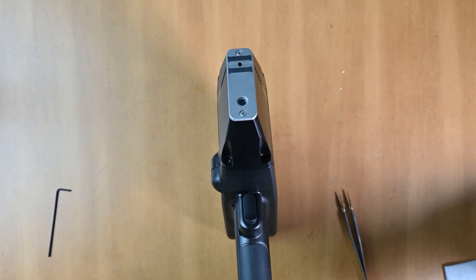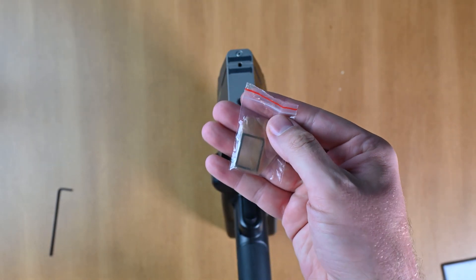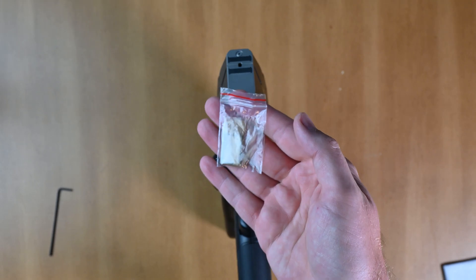Keep in mind that in general, you shouldn't need to replace these blast shields too often. And if you need more, you can find more on alloygeek.com.